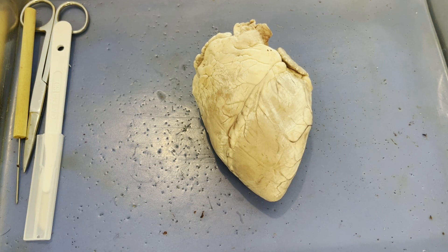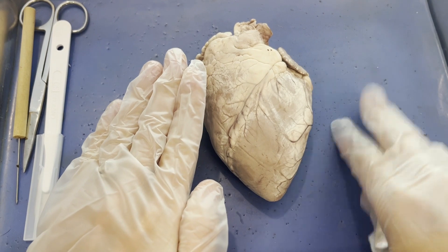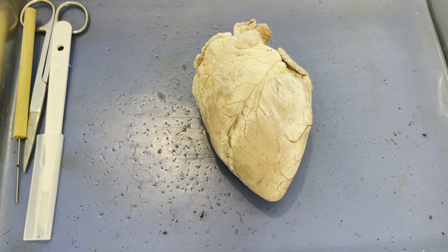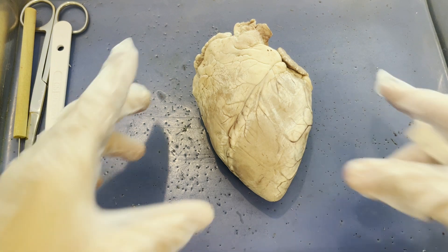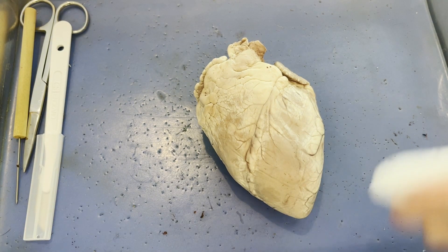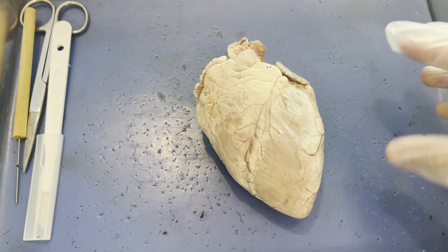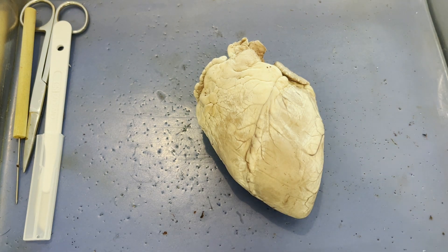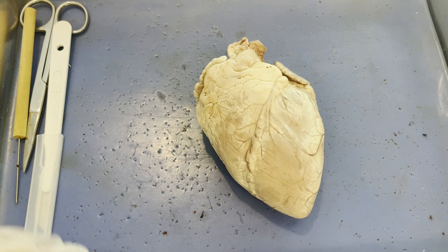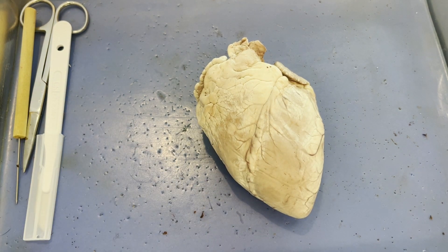One final set of directional terms is right versus left. As I always tell my anatomy students, you need to be the patient, be the sheep, be the specimen. If this were a patient lying in front of you with their heart in their chest during open heart surgery, the side you would hold their left hand from would be the heart's left side, and the other side would be the heart's right side. You can even move your body and pretend you are the patient to figure out which side is which.